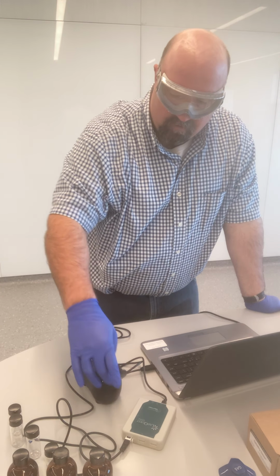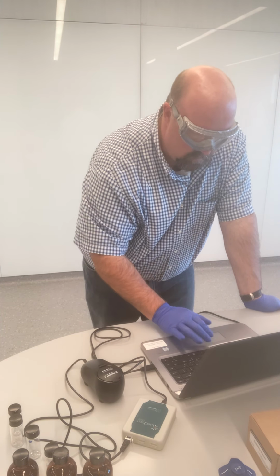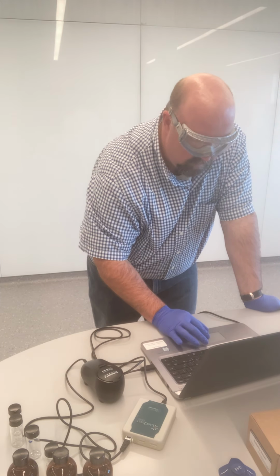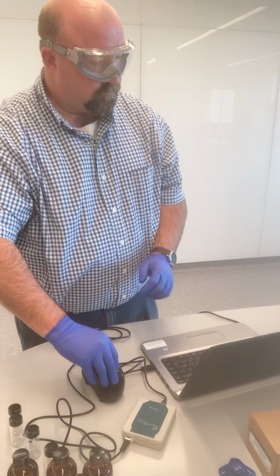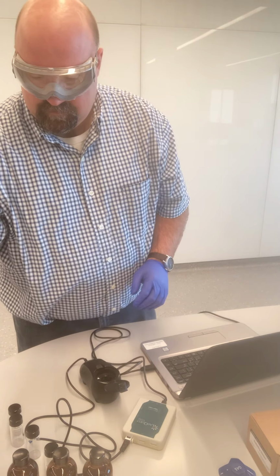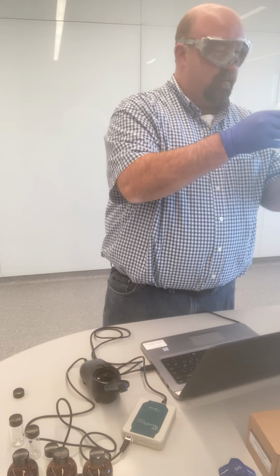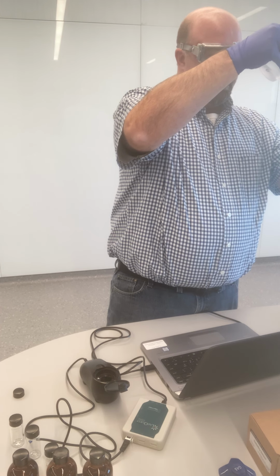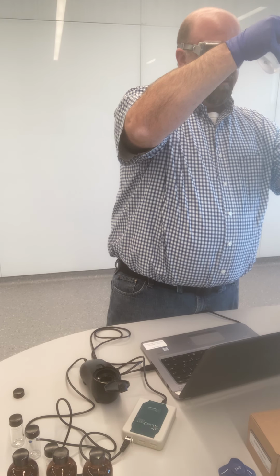So I've got my 100 NTU standard in there. I close the lid. I type, oops, I need to calibrate now, 100. And I'm just, again, going through our calibration instructions. Next, I'm going to just use some distilled water. So I'm just going to fill one of our cuvettes up to the line with some distilled water.